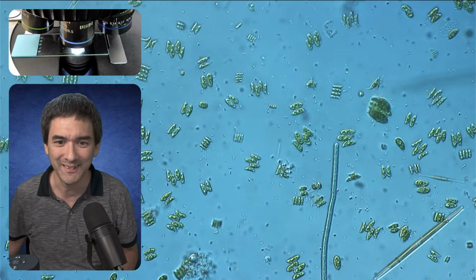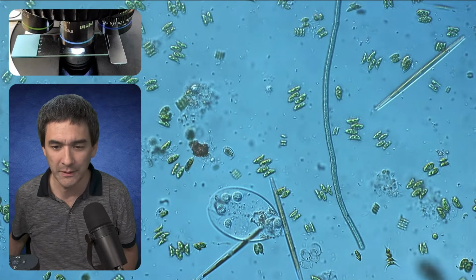So here we are again. I think it might work.